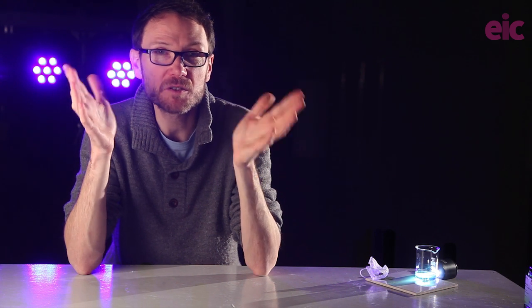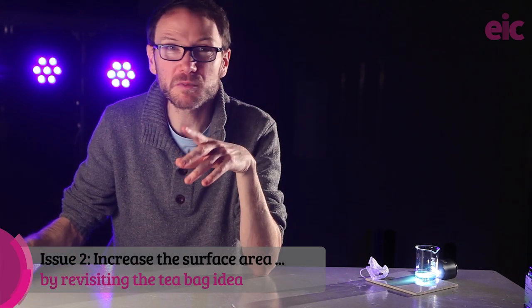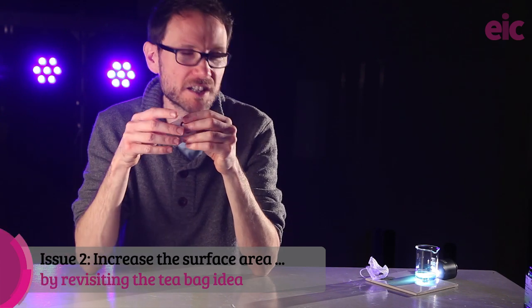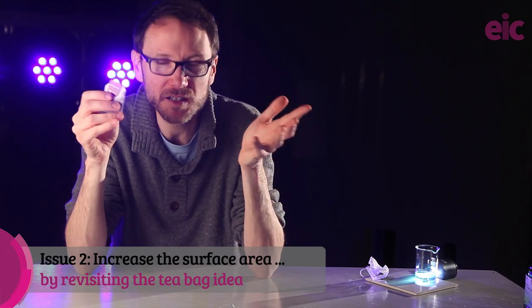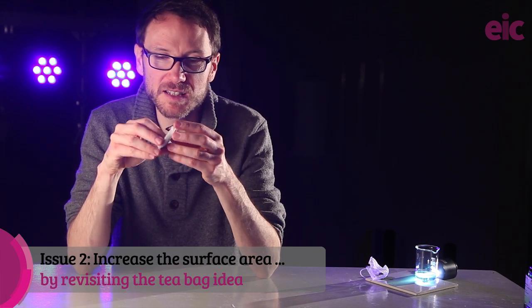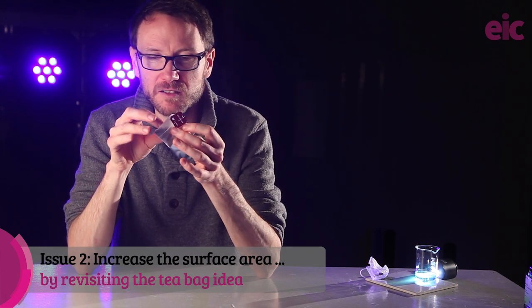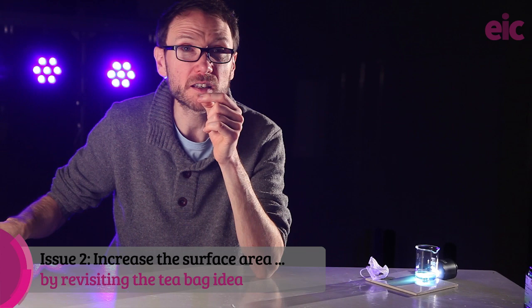This is where I put the call out on social media, and I was not disappointed with the fantastic help that came in reply. One really important piece of advice that I got back from Michael Ryan, he suggested that he'd also been using tea bags for some time with this experiment, and it got me thinking that actually maybe these kind of loose leaf style tea bags that I just happened to find in the cupboard when I was trying this out weren't the best option. They might have different properties from these kind of like string tag wrapped up cylinder with a staple on top type tea bags. So I thought I would give that a go.